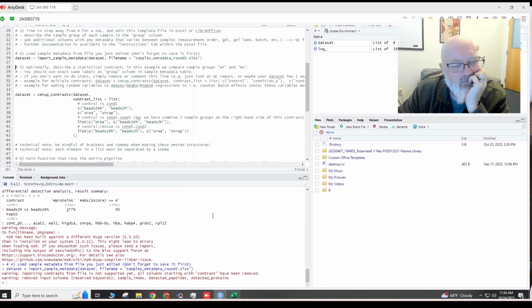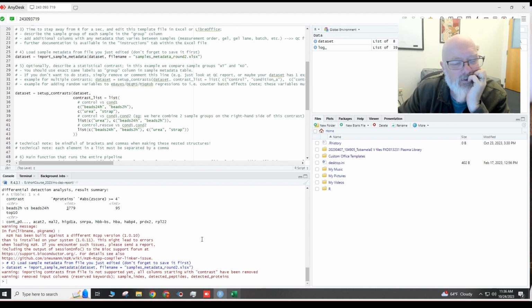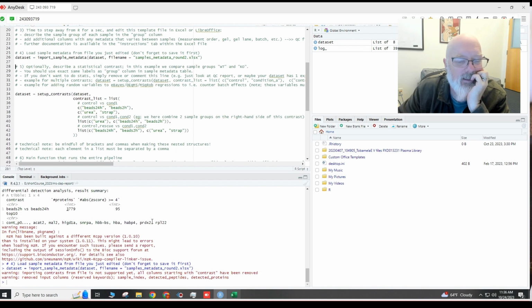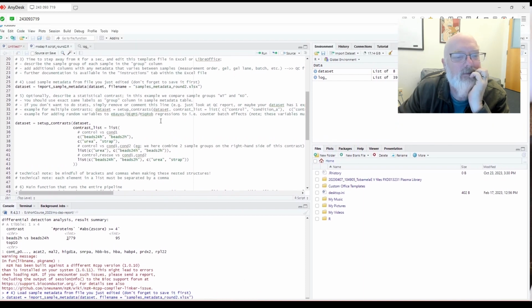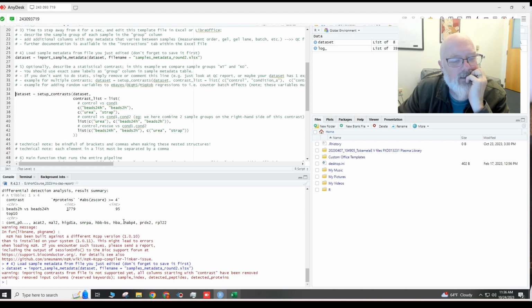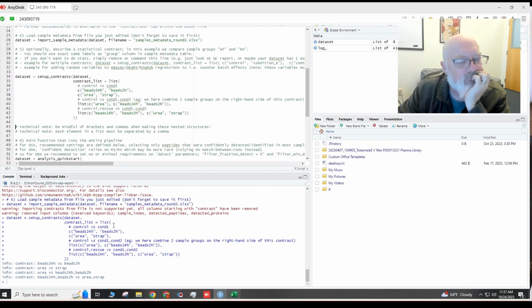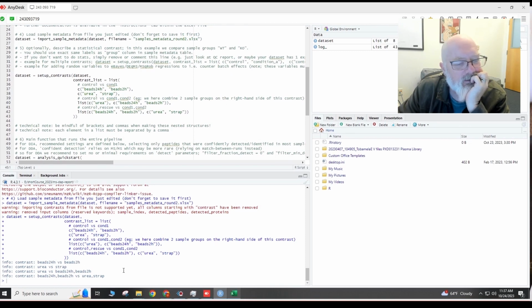Okay. Importing contrast from files, so all columns starting with contrast have been removed. Okay. All right. Warning, removed input columns, reverse. Okay. So anyway, it didn't need the contrast, so those have been removed. All right, so that's fine. I think that all worked. Sample metadata files. Don't forget to save it first. All right, let's go. So now we're going to load these contrasts. So I'm going to put my cursor here and hit run. Okay. Beads versus urea versus S-trap.